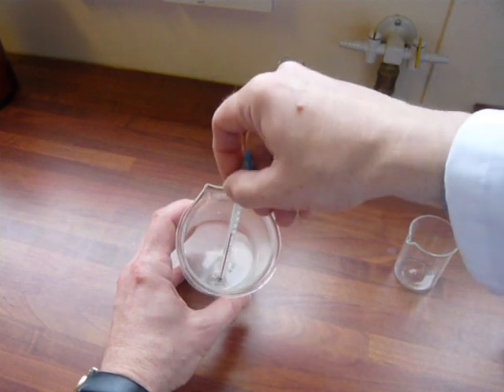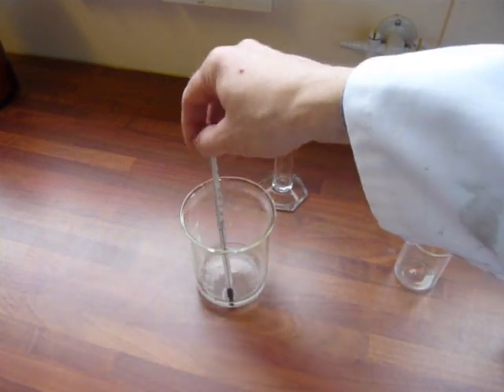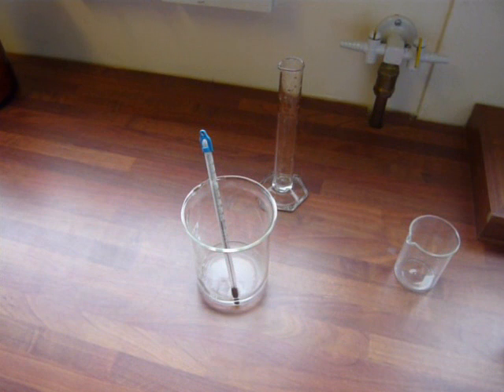Now we're not going to get very accurate results from this experiment, because I'm using a beaker, and a glass beaker is not a very good insulator, so we want to improve our experiment by using something that isn't going to lose heat to the surroundings.